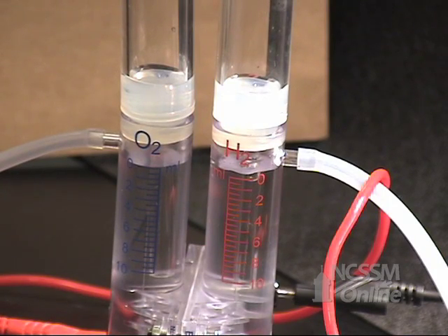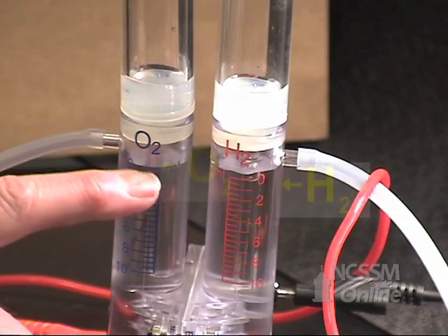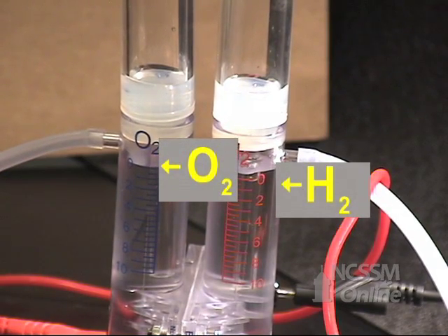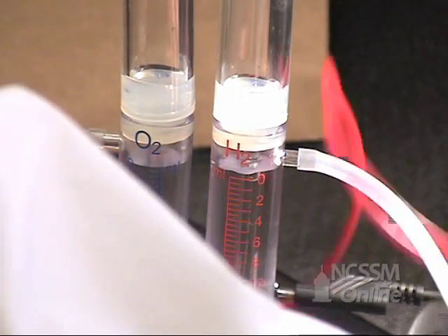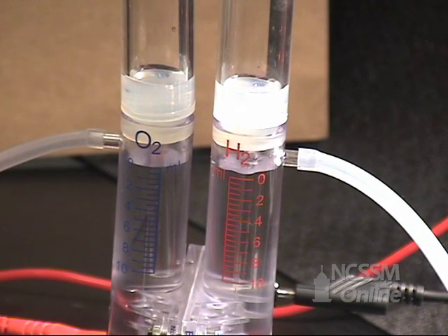In this electrolysis, we fill both containers to the zero mark, and now we're going to start our reaction, and I want you to watch the hydrogen and the oxygen being formed and the ratio at which they're produced.